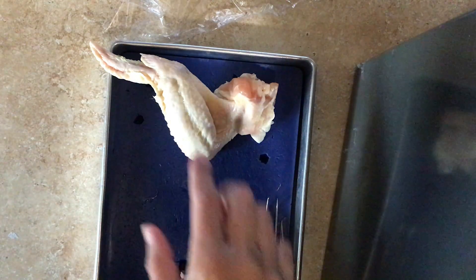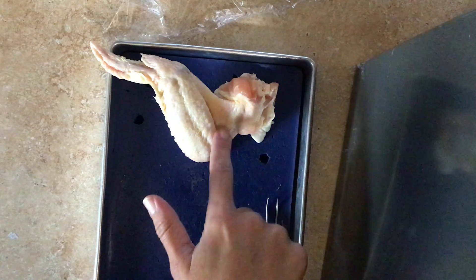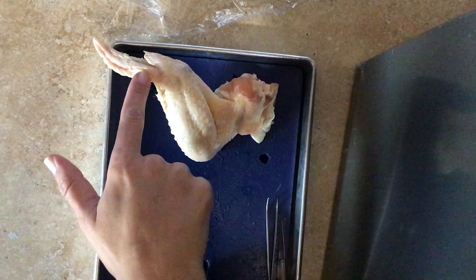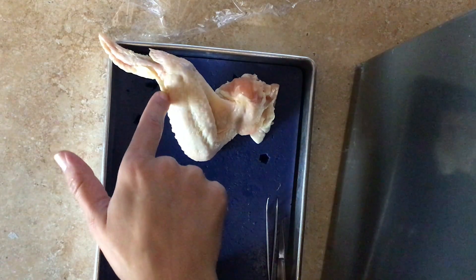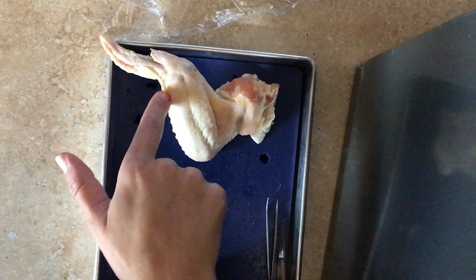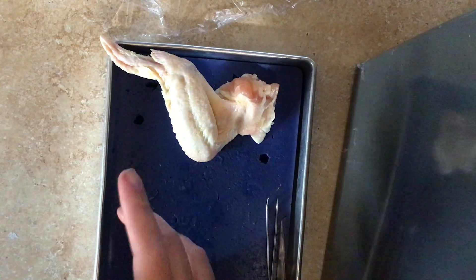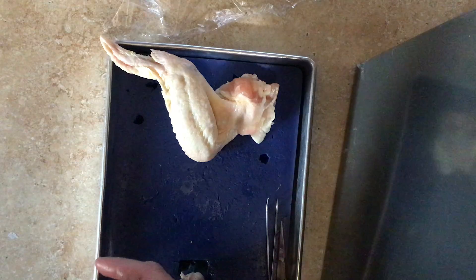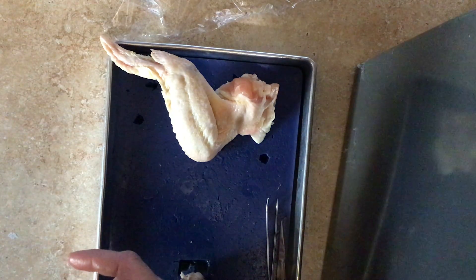Here's the outer portion of this. It's really hard to see on the wings, probably specifically in this video, but we'll see yellow deposits. Yellow deposits are fat, and that's something you want to talk about — something we talked about in class — where adipose tissue or fat deposits are actually stored in which tissues.